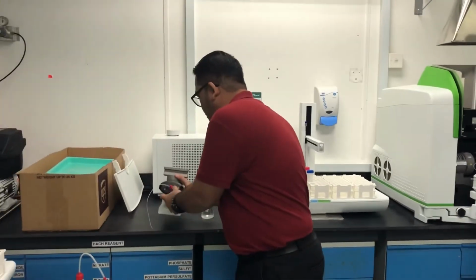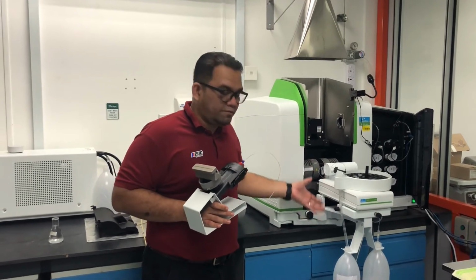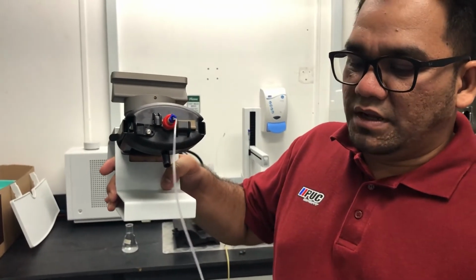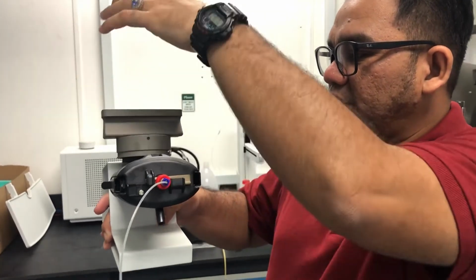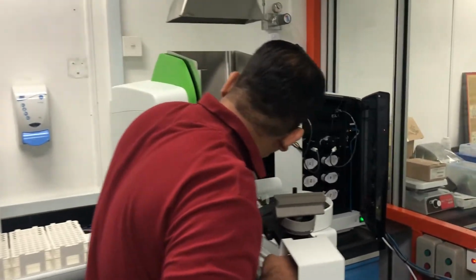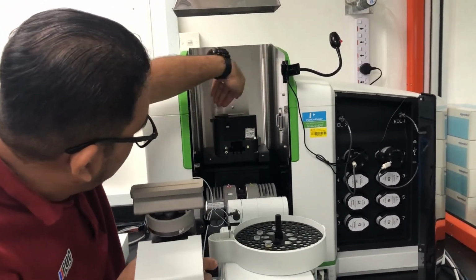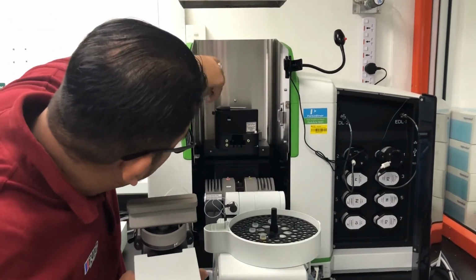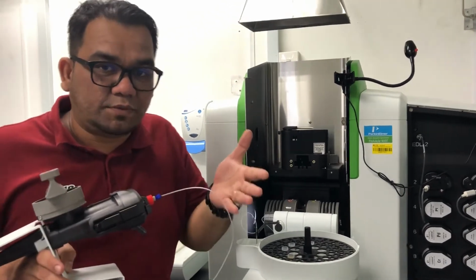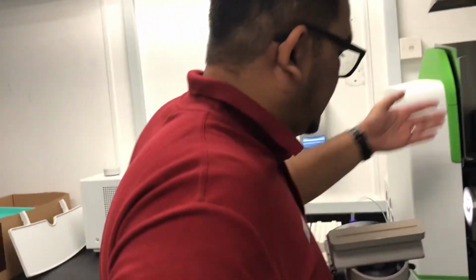Remember, as I told you, AAS, flame or graphite furnace, is the same instrument, and we only change the compartment. This is the setup for graphite furnace, and this is the setup for flame. This is how the sample is pumped inside the nebulizer, and then the flame will be here. The sample will be pumped into the flame, and the light source, the lamp, is from here. The flame will be over here, and then the absorption will be measured by the detector. We have the detector inside this compartment, so the instrument will measure how much absorption occurs inside the sample that has been burned in the flame. Okay, so this is the setup of graphite furnace.